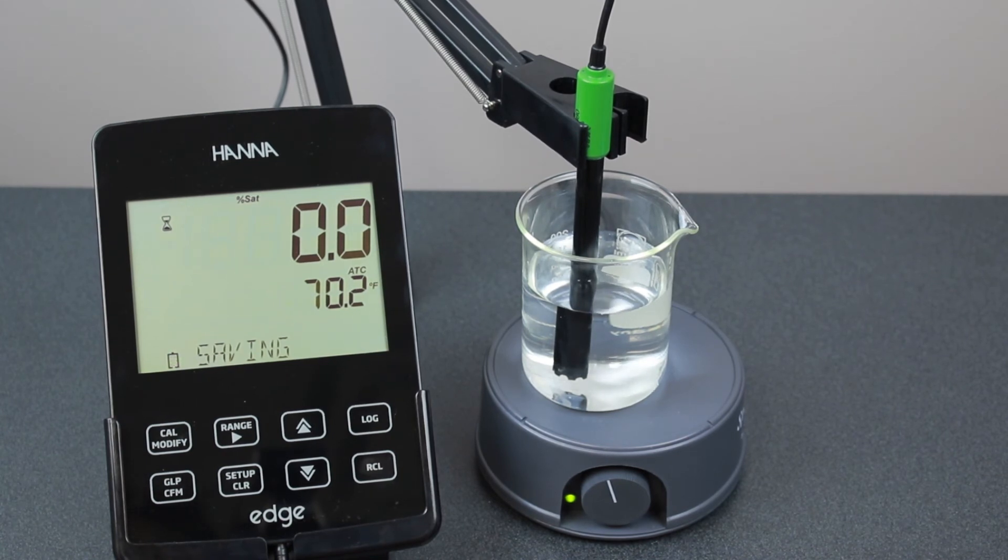Rinse the probe tip off in water before taking measurements in samples. So that's it. The EDGE multi-parameter meter is perfect for business and educational lab use.